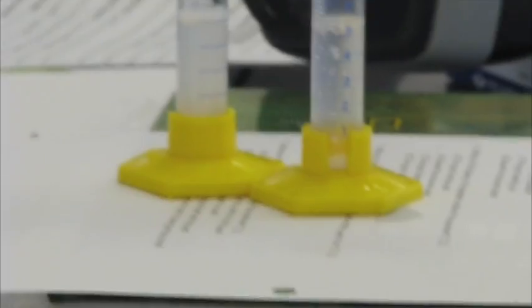When iodine touches starch, it's going to change another color, and it's very obvious what color it's going to turn. So we're going to wait five minutes and we're going to see what happens. Turn that off.